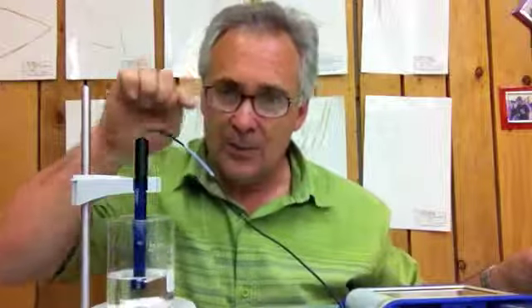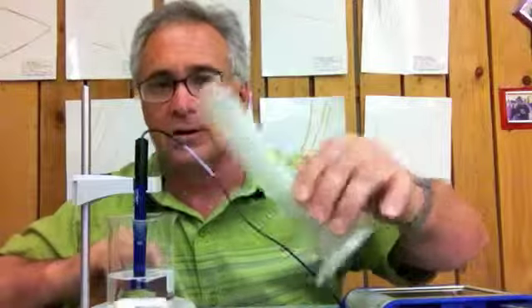Once that's done, I'm going to continue to let it run. Don't turn it off. Let it keep running, and then I'm going to pour in all of my vinegar and let that run for 10 to 15 seconds. Then stop it. So it's really important that you follow directions. I'm going to let you catch up to me, get all your stuff together. Then I'm going to run this and see how you do.